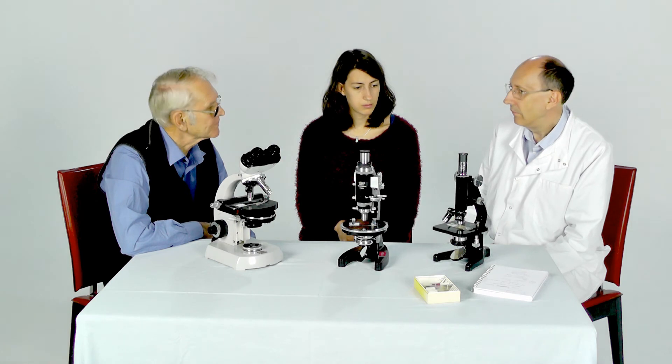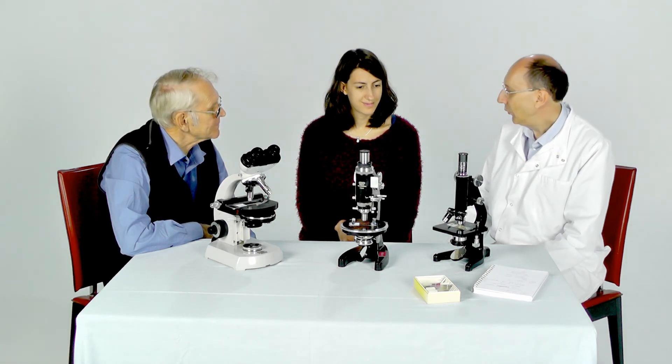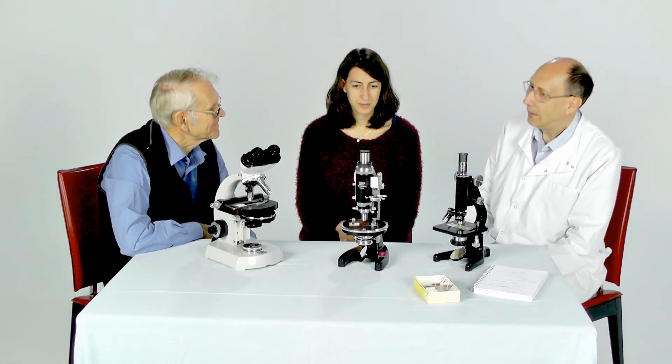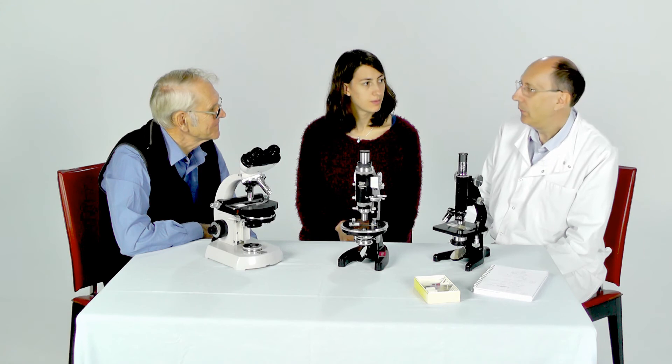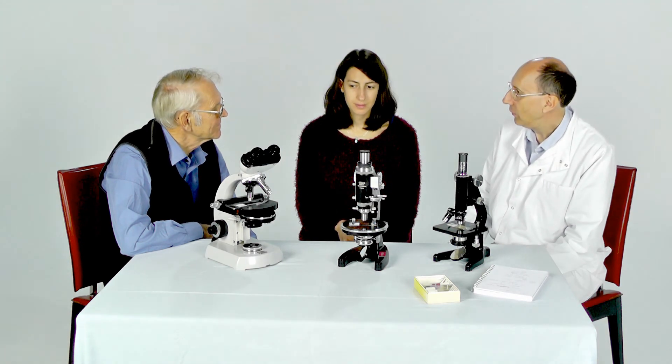So condensers — the hidden important element of any microscope — but it's well worth finding out a bit more about them and using them properly.